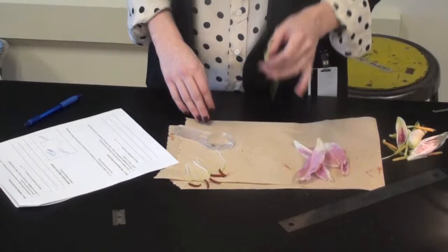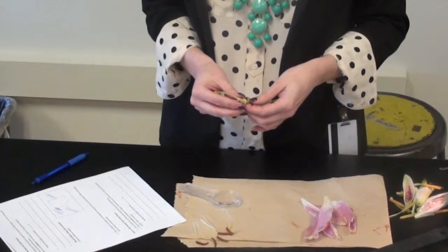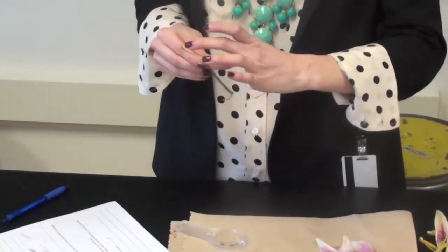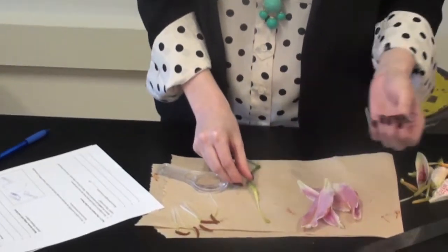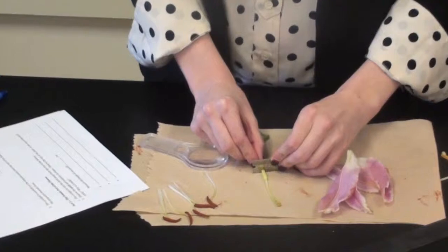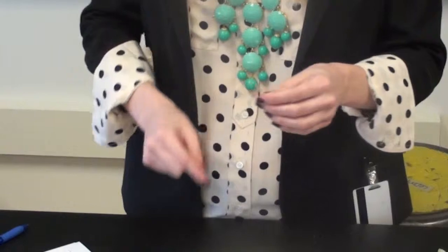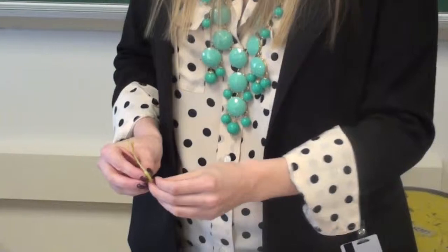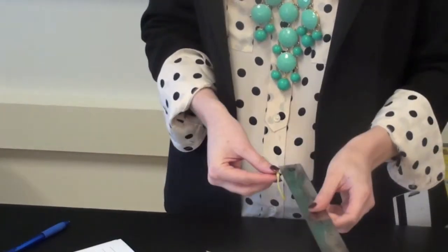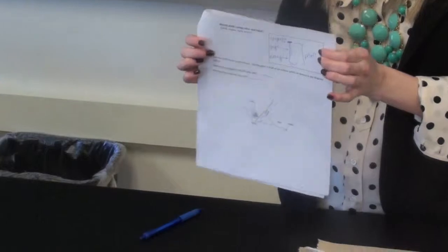Okay, then you're going to move on to the female part of the flower, which is the pistil. So for the pistil, once again, you're going to measure the entire part of it. So this is the part where you would come up to me and I would cut it for you because the razor blade's very sharp. So you would just cut it off from the stem. So once again, label all three parts of the pistil. Measure it with the ruler in centimeters. And then in the box on your lab sheet, you need to label and draw the picture.